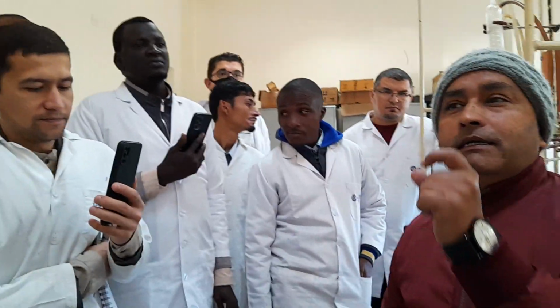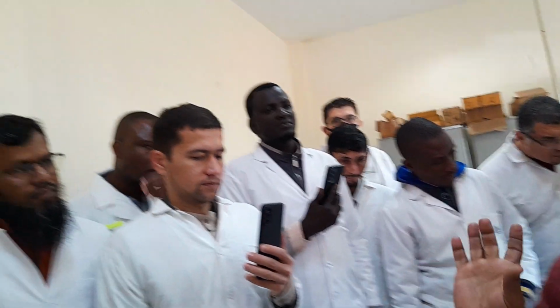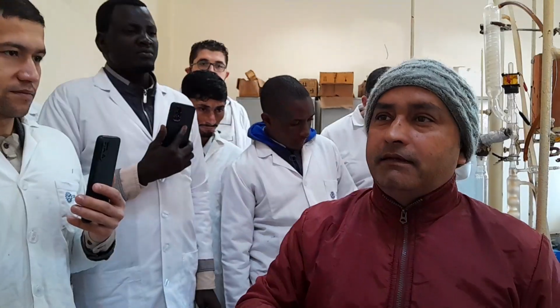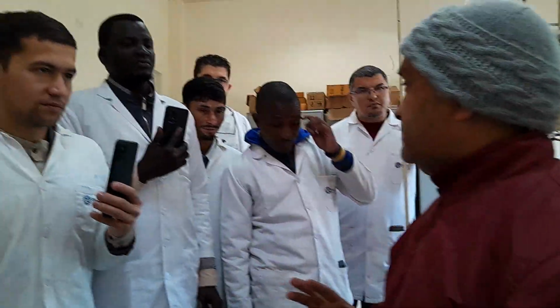The IBP is the temperature at which you get the first drop inside the receiver. Okay, that is the definition, simply. But my question is, what is the difference between the IBP of D86 and the IBP from the fractional distillation? The IBP from the fractional distillation will always be less than the IBP we get from D86.